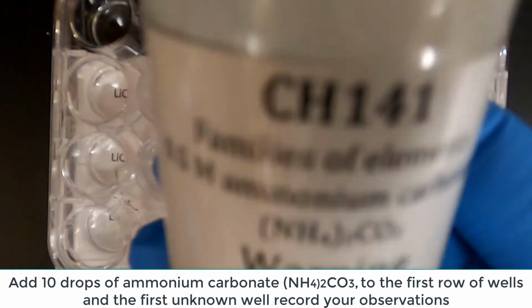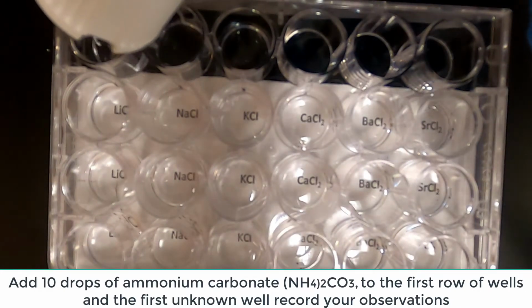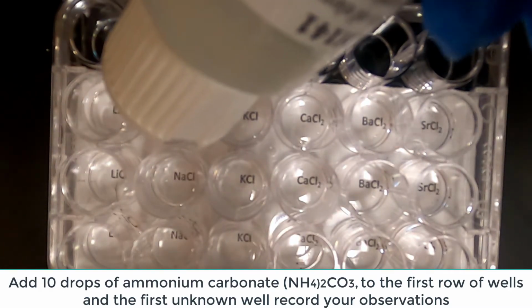In the first row, in the first unknown well, add 10 drops of ammonium carbonate. Observe the reactions. Record your observations on the data sheet.